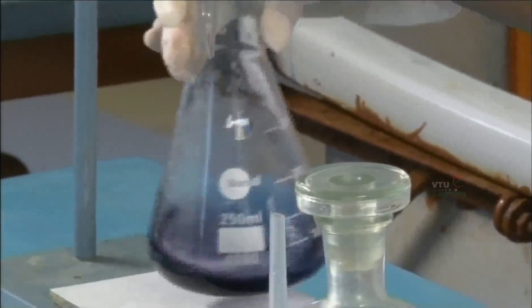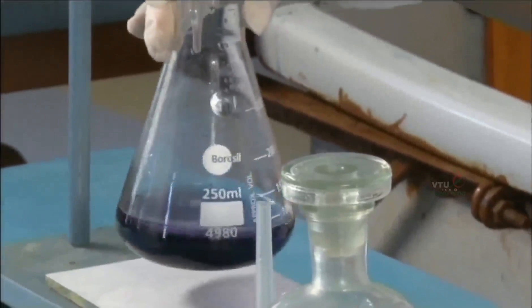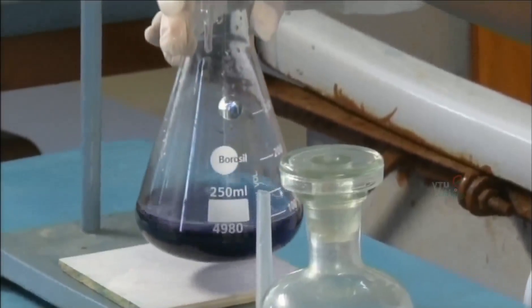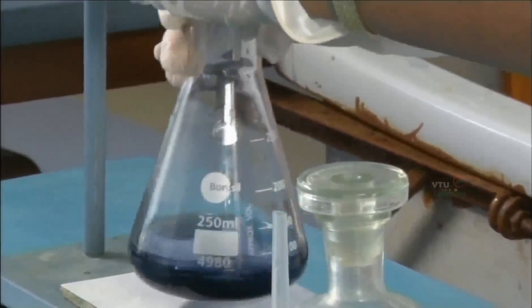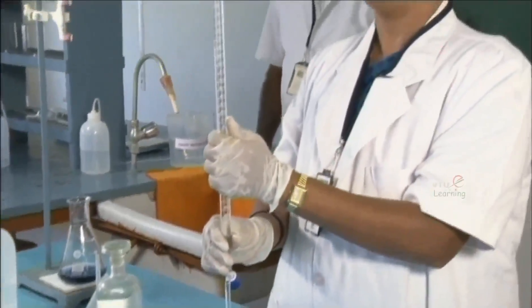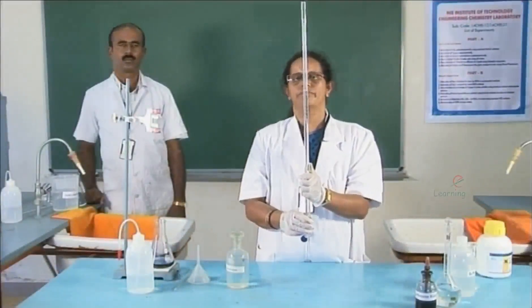The solution addition is stopped when the wine red colour turns to a clear blue colour. This is the end point of the titration. Now hold the burette at eye level and read out the burette reading. The final burette reading is 16.